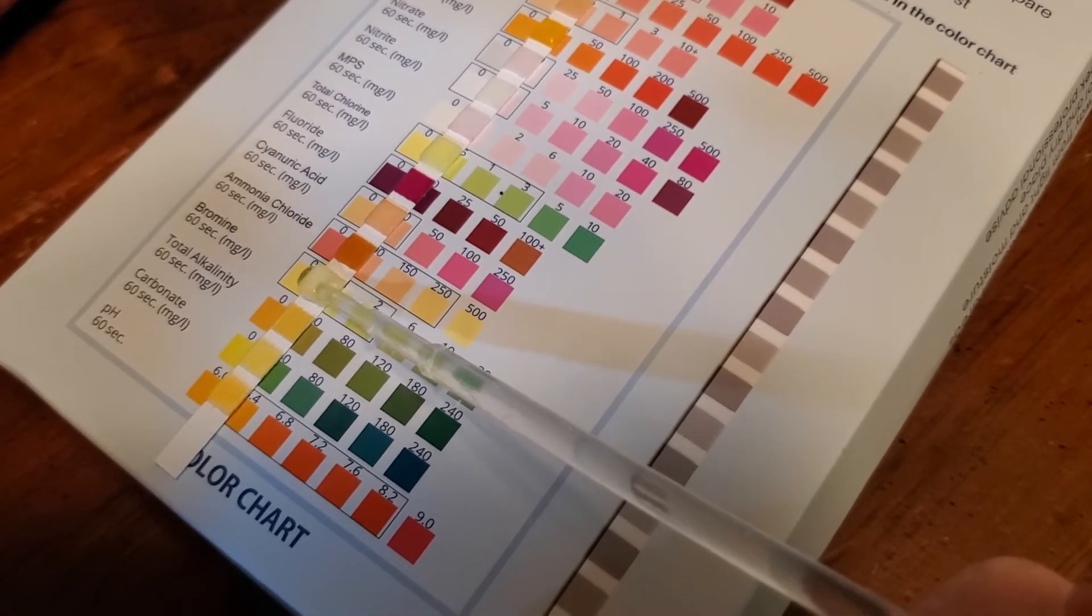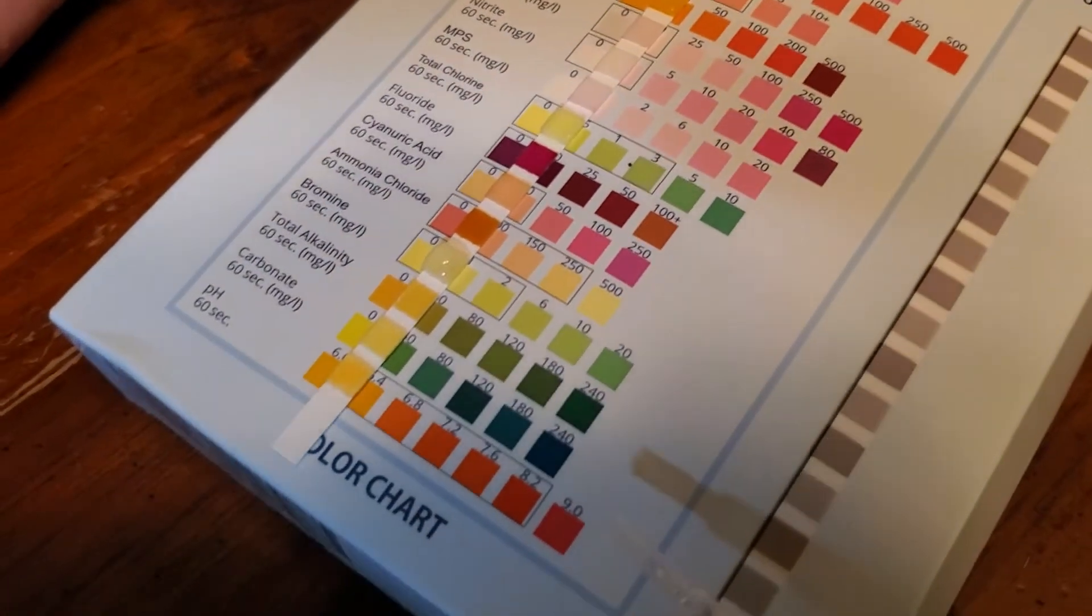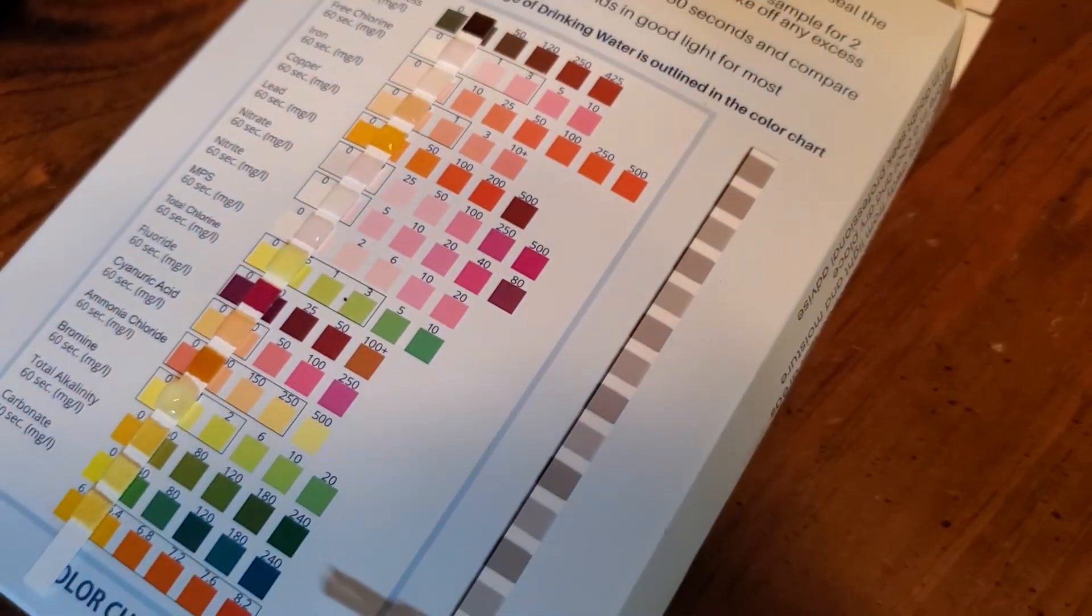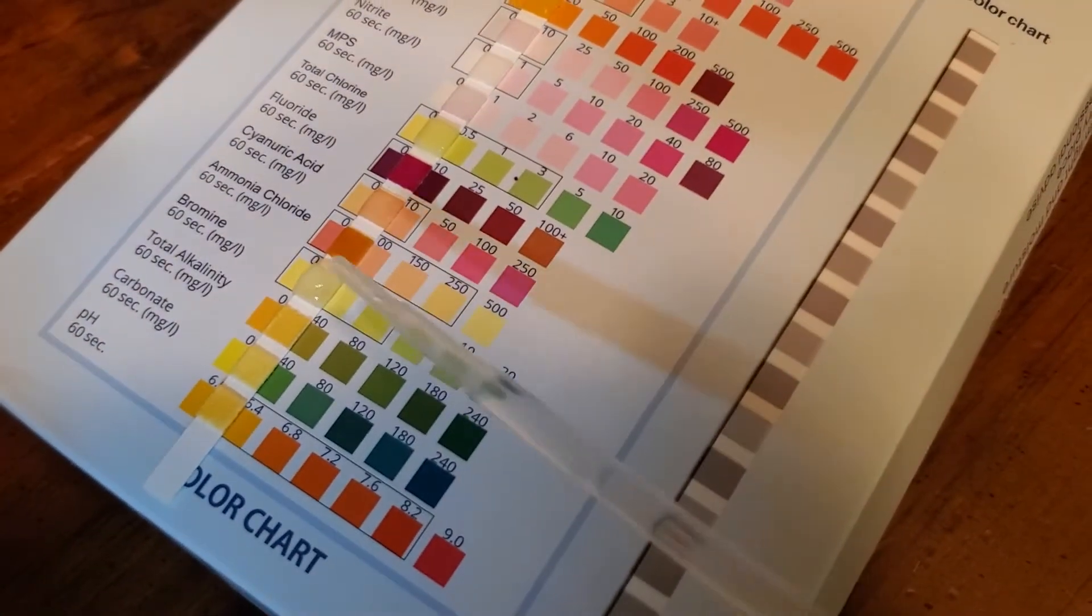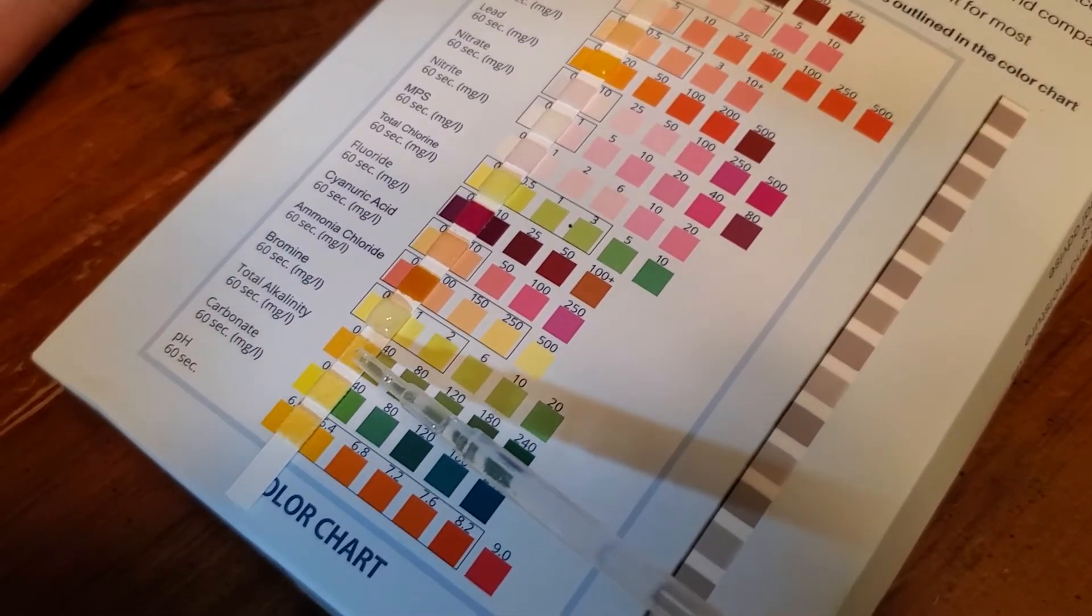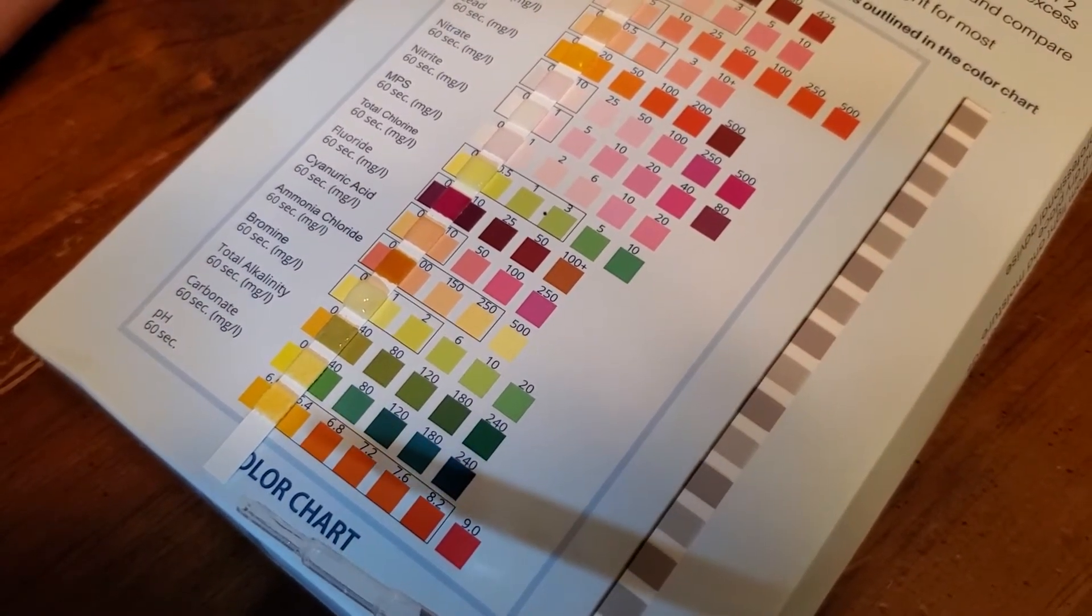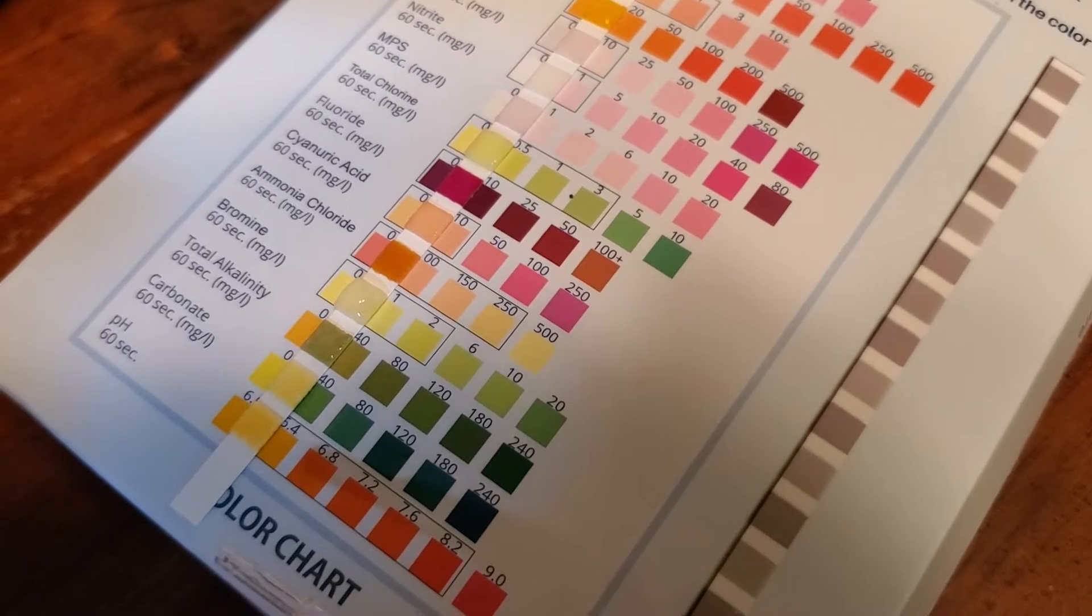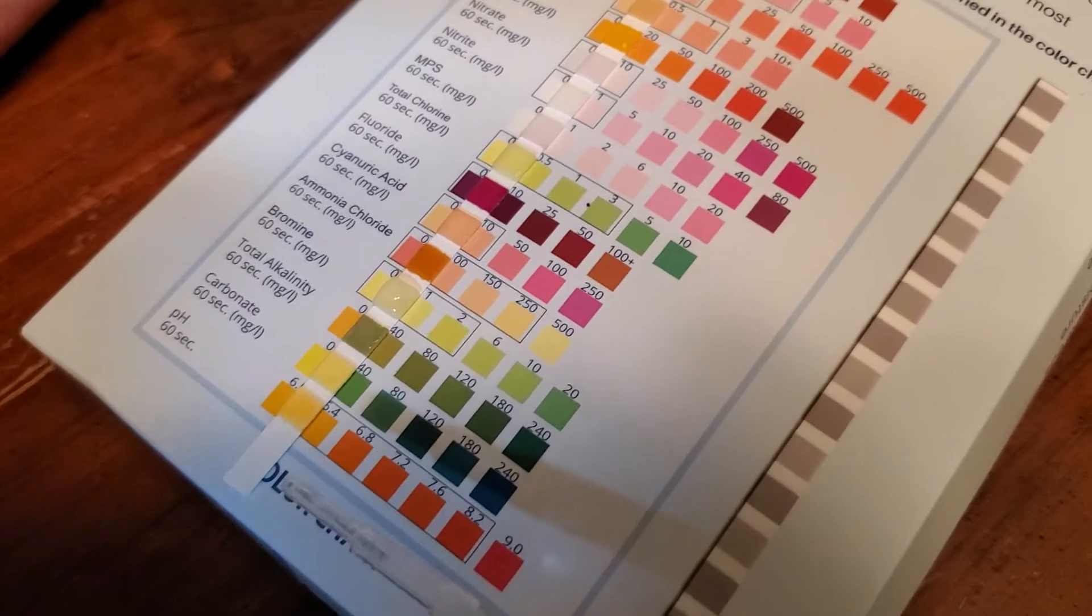Now we're testing bromine. Isn't that the stuff they say that's so bad that's in Mountain Dew? The water didn't absorb, it's just sitting there in a big giant bubble. Let's just give it a chance. Alkalinity. Maybe it'll soak in if we just give it a chance. We're right about 40, that's like an almost perfect match. Yeah that's amazing. Awesome, that bromine thing is still like nope not going to take. Oh now it looks more like 80. See how quickly they change.